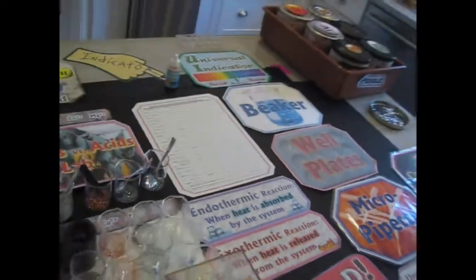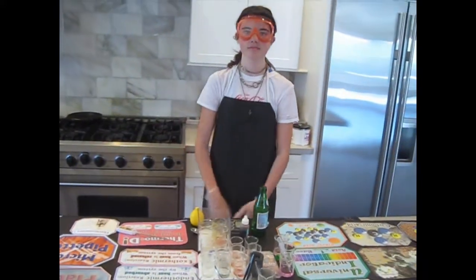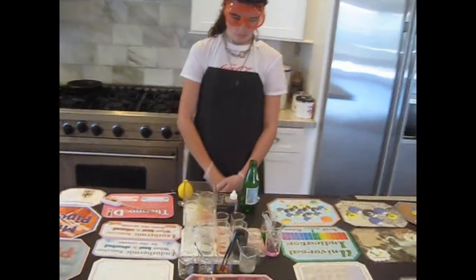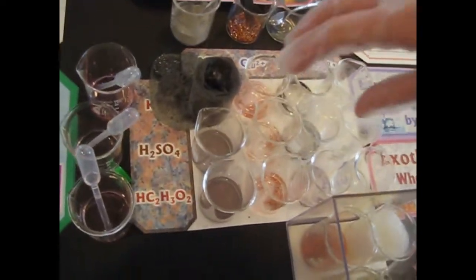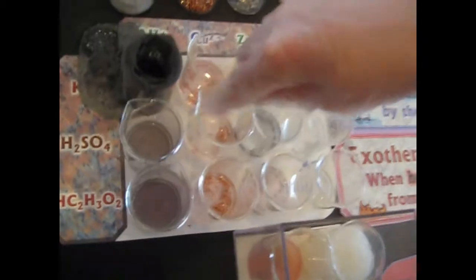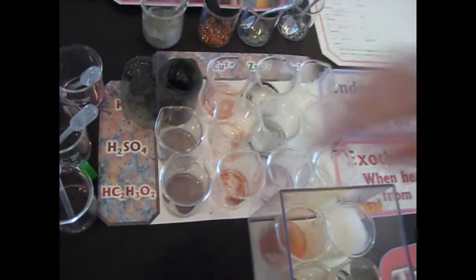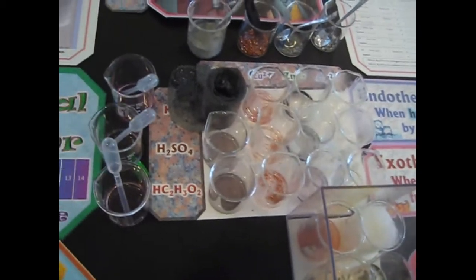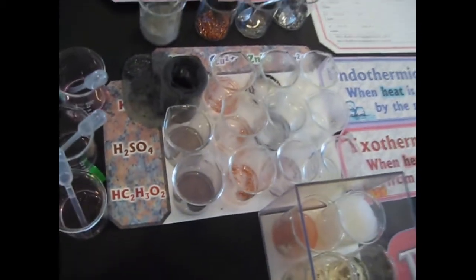And so let me go around here. And thank you, Giovanna. That was a great experiment. Could you please point out one last thing? Which of them do you think had no reactions at all? Okay, I would say these four. Those four had no reaction whatsoever. Yeah, the temperature didn't even change on those. Okay, that's a good sign. This one went up slightly, and I think the most visible reaction was this one.